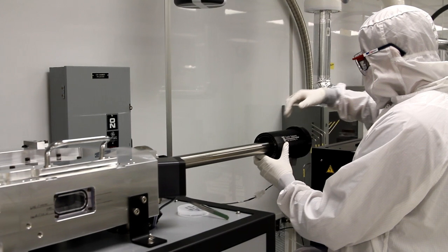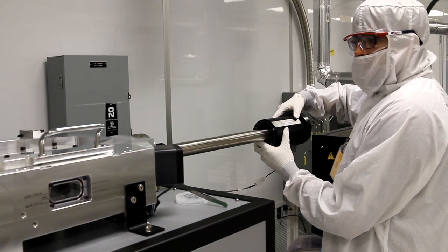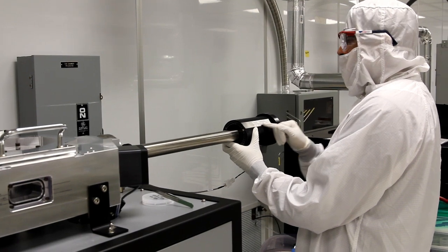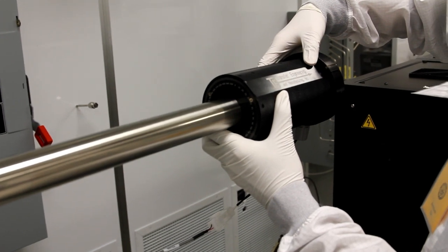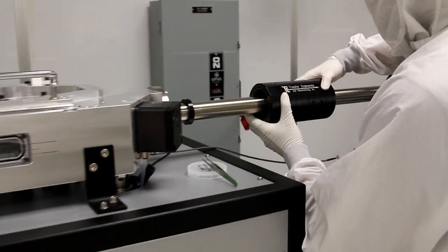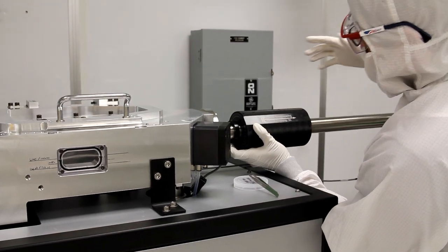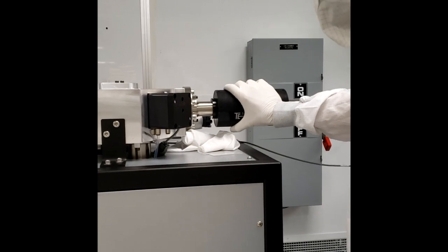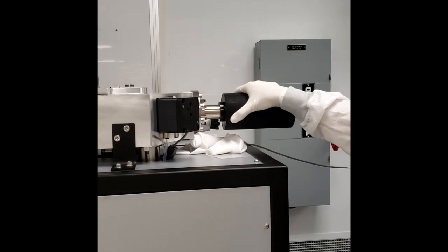To unload the sample, we have to move the transfer rod inside. We make sure the arrow on the transfer rod is once again aligned with the preset mark on the end. Then, we slowly take the transfer rod inside. Rotate the rod 30 degrees toward you and push very gently in so it's flush with the metal. Then, rotate it back 60 degrees toward the wall, and then you can pull it back out.